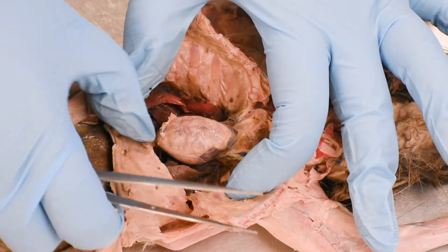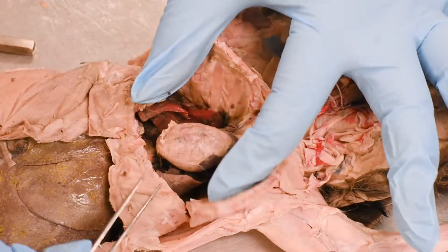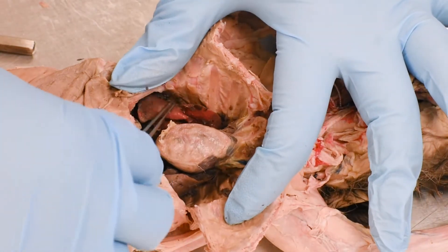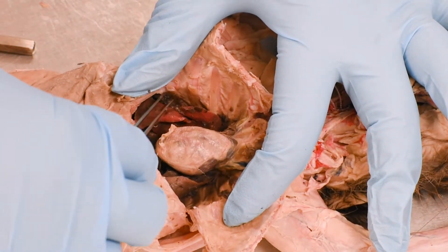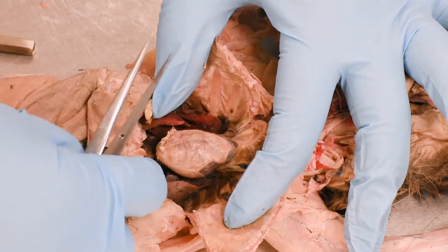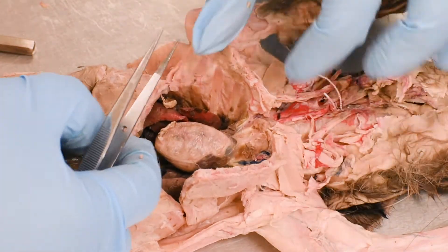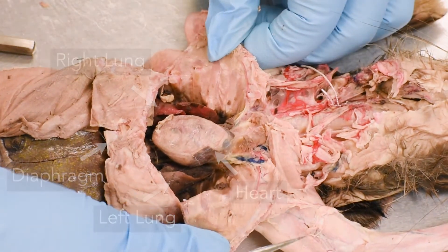Laterally, these are the lungs — this will be the left lung and this will be the right lung. The diaphragm is over here. This is the thoracic cavity.